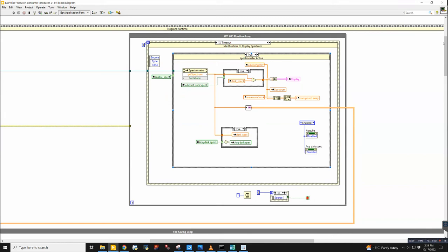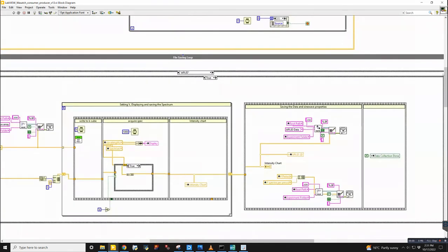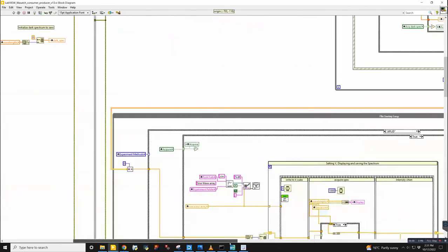So this data collection loop is connected to a loop that's running in parallel. This is a file saving loop. And they're connected by this channel writer. A channel writer you can think of as a tunnel between two different loops, where this loop will output the data from the spectrometer and run along here and pass it into this second loop.